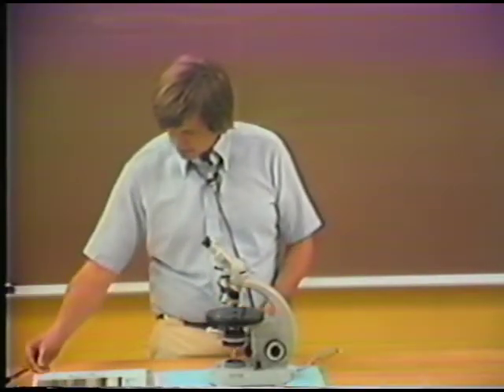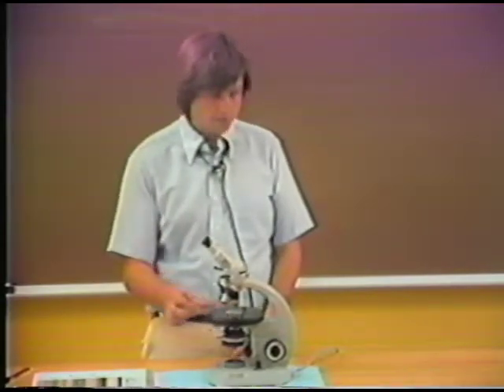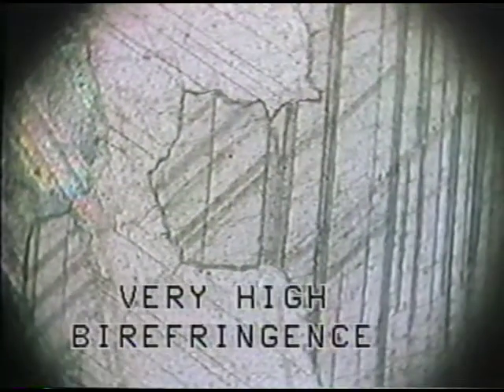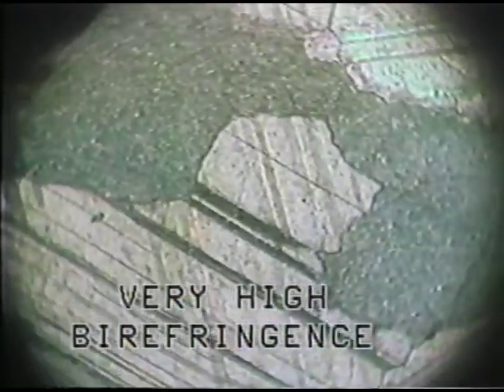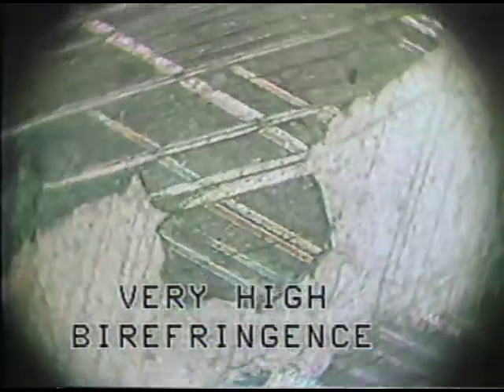So now let's move to a thin section of a marble. Marble is made up virtually entirely of carbonate, and the carbonate minerals have a very, very high birefringence. Here again, looking in cross-polarized light, you can see that the birefringence of calcite results in very high order interference colors. They appear almost iridescent, and you can also see some complex twinning within the calcite grains.